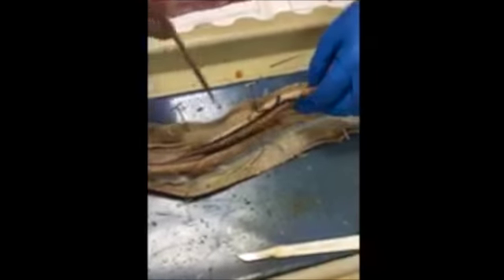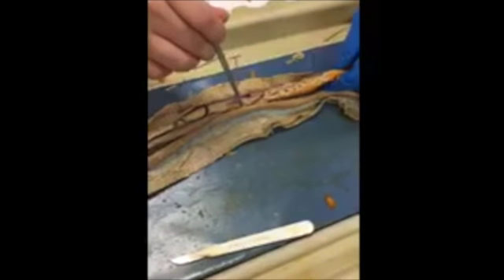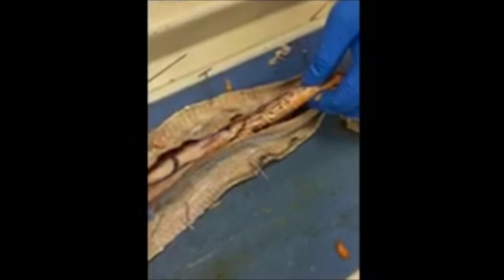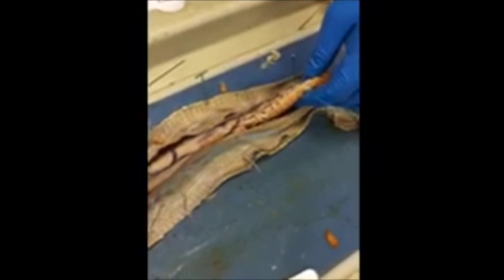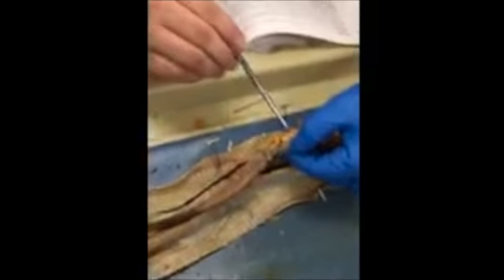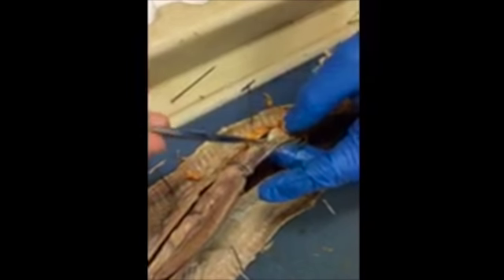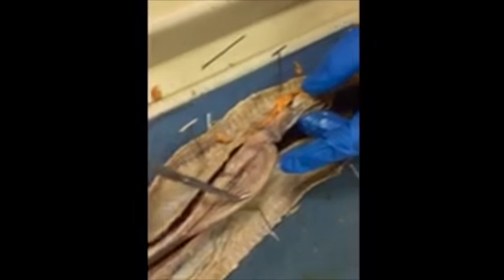And then after that, the stomach secretes acid juices, which break down the food to get all the nutrients, and then that broken down food goes into the intestines, which is the point where it absorbs the nutrients from the food into the body and the bloodstream. And then the gallbladder down here, that's going to be located right here. You can see it. So the gallbladder basically just stores and concentrates bile that is secreted from the liver.